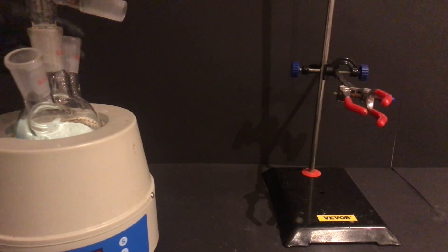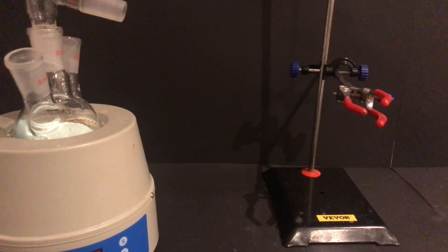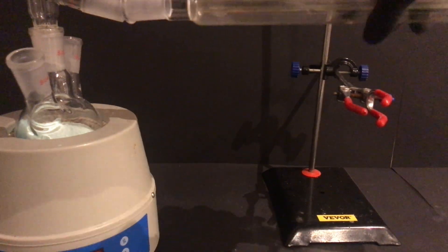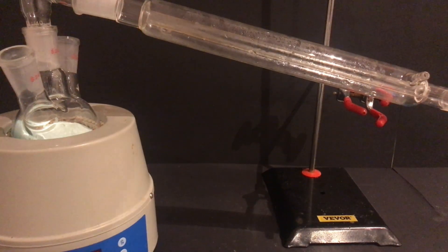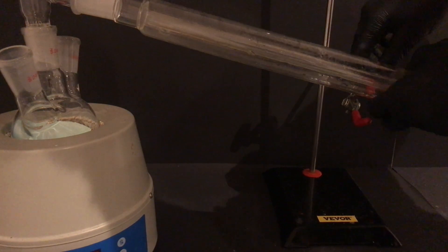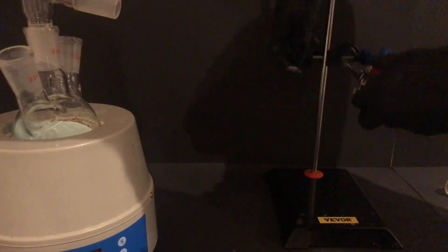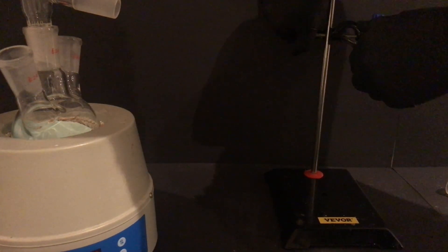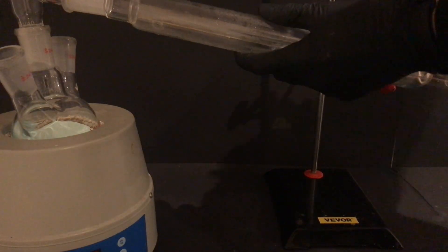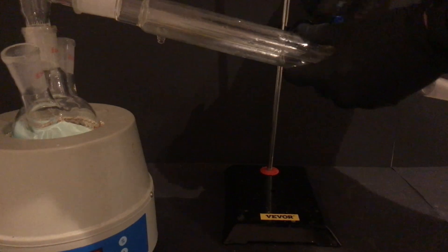The 250 ml boiling flask was set up for a simple distillation. I did not use a stir bar because the stir bar would not work in a decarboxylation reaction, since there is no liquid and the powder doesn't mix very well with a weak stir bar.